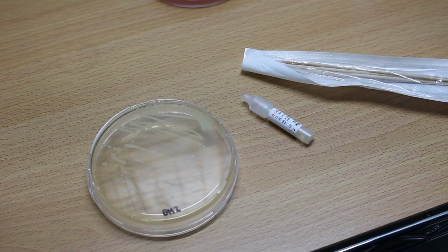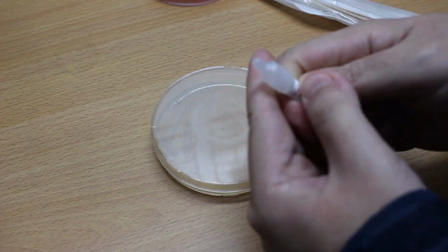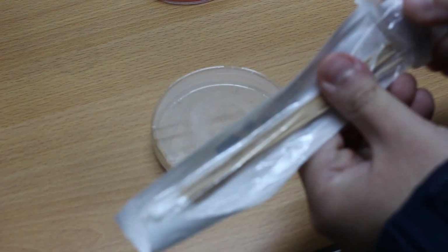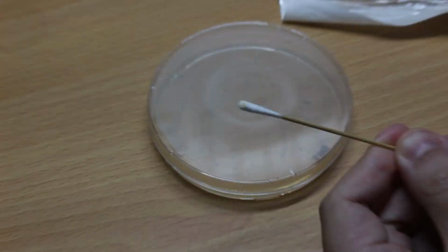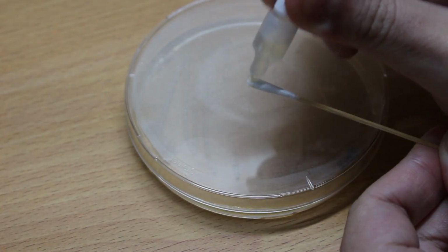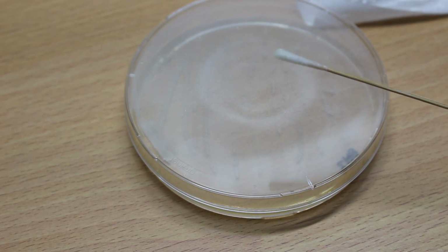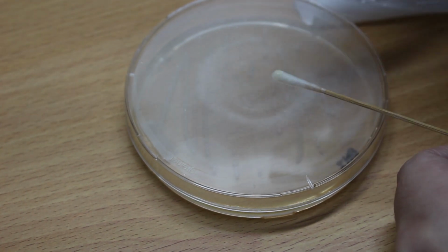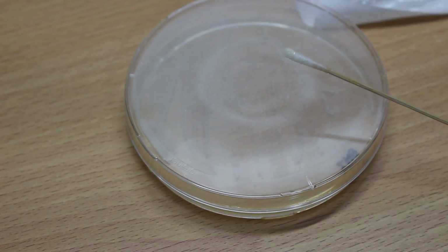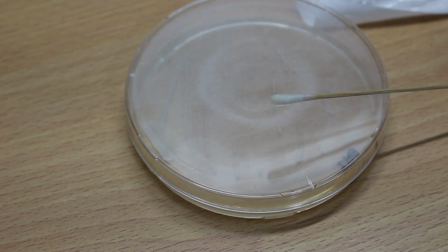Oxidase is an enzyme in the electron transfer chain and is present in our cells, but not necessarily in bacteria. I use this oxidase reagent. The chemicals contained inside will be oxidized by the enzyme and turn blue. And here you can see the colony shows no color change. That means the test result is negative. The features that I'm testing here are characteristic of the Enterobacteriaceae family, the poop bacteria I'm looking for.